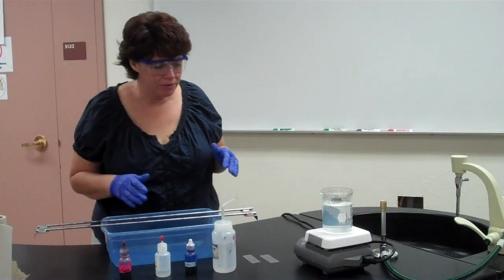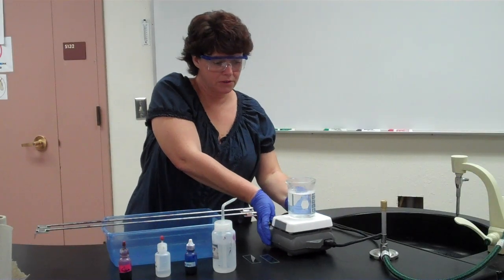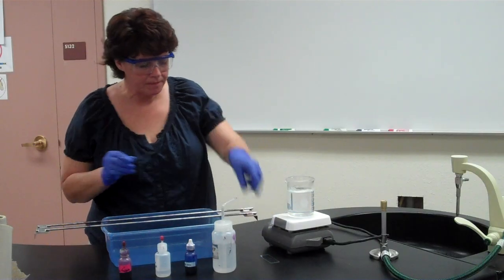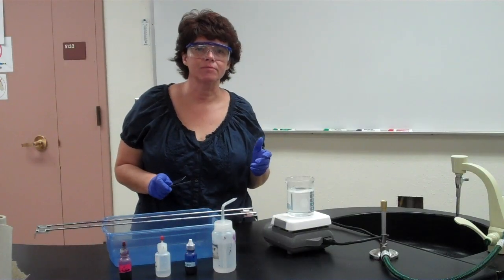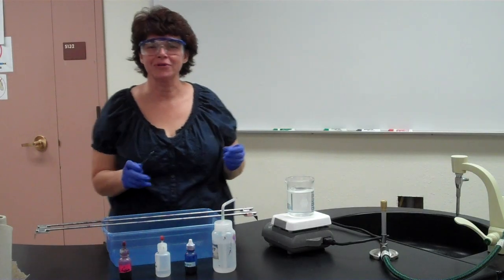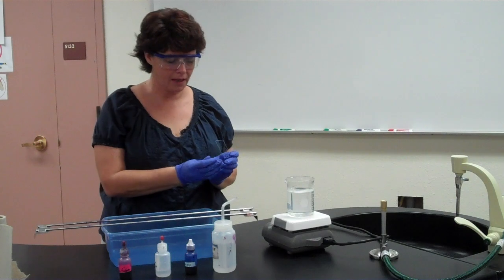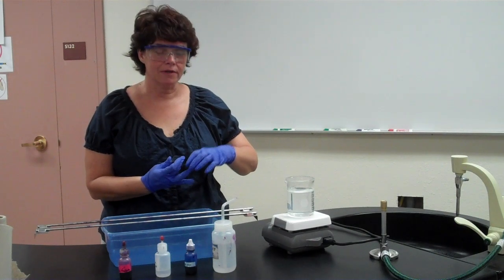And so what we're going to do here is we're actually going to steam our bacteria. I'm going to move this a little bit closer. All right, and that's where we start sweating. So I have my bacteria, my slides. Now remember, with all staining procedures, you're going to fix them before you ever go to stain them. The only time you're not going to fix them is if the procedure says do not fix, okay, which we'll see later.